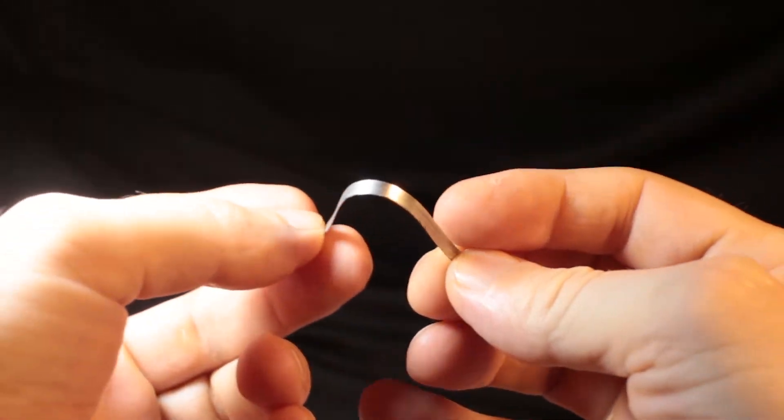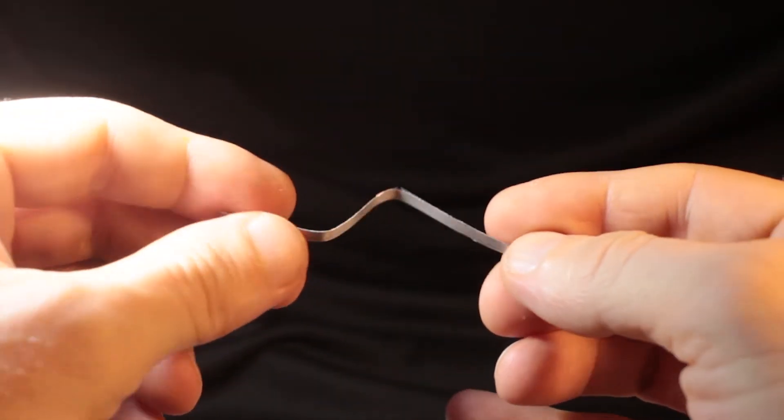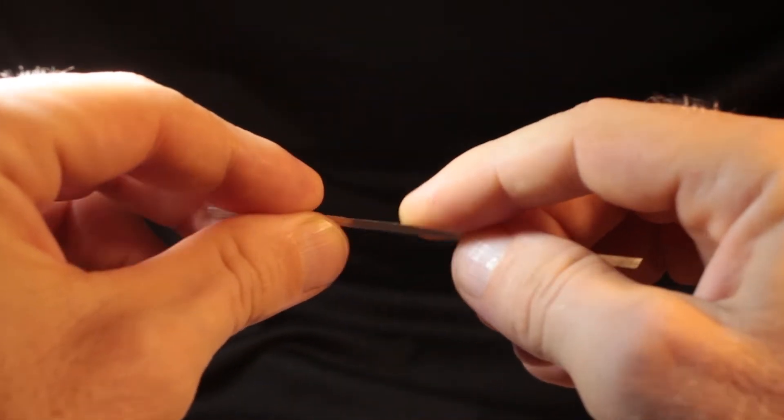The metal itself is pretty soft, you can even break it in your hands, but we are not going to do that. We are just going to burn this strip.